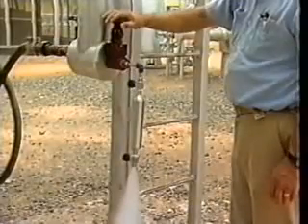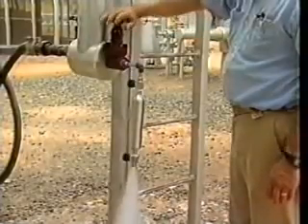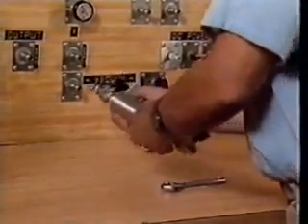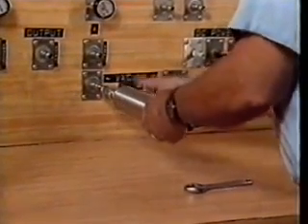In the evacuated cylinder method, a sample cylinder is cleaned, dried, and evacuated. Now, evacuating a cylinder basically involves removing the air from it through the use of a vacuum pump.